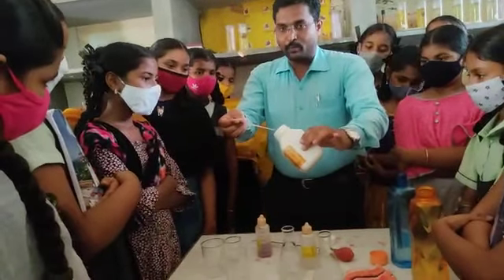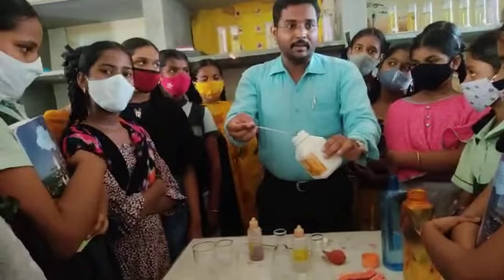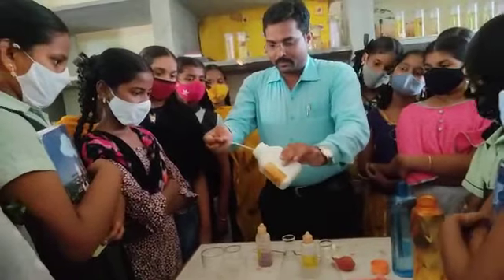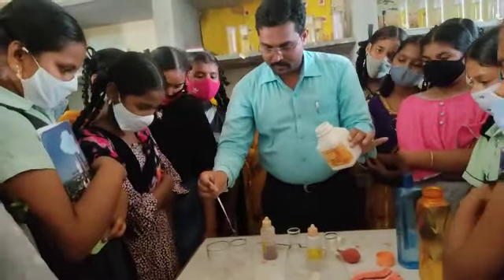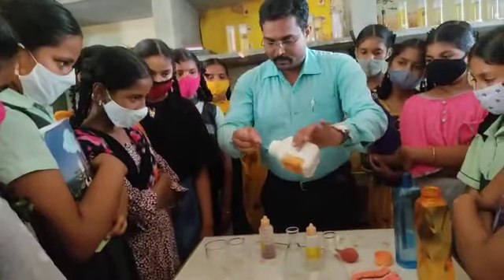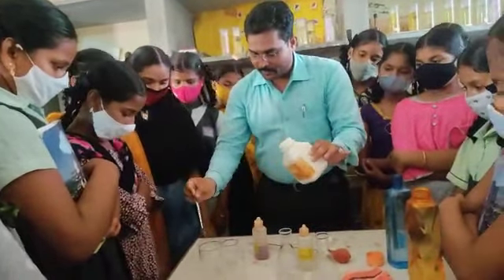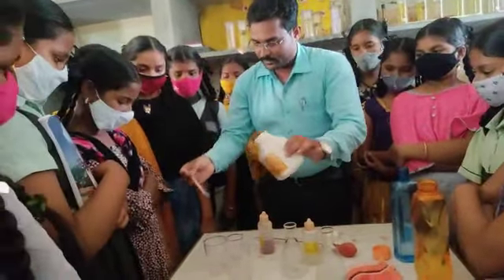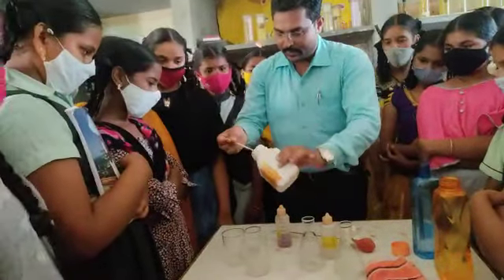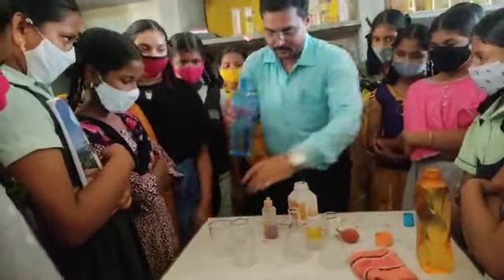Now this potassium hydroxide looks like a liquid. Actually the potassium hydroxide is in the form of a solid, it is in solid form, but it has melted. So take potassium hydroxide, one or two spatulas, into one beaker. Another beaker also contains base solution, base potassium hydroxide. Okay.